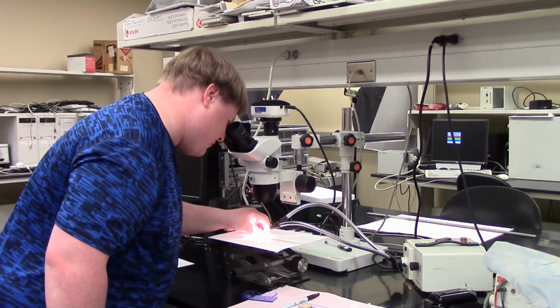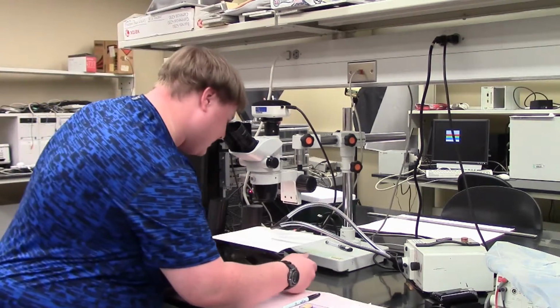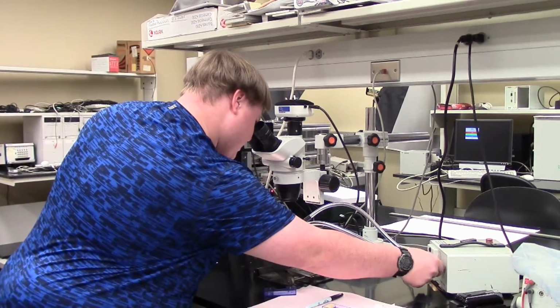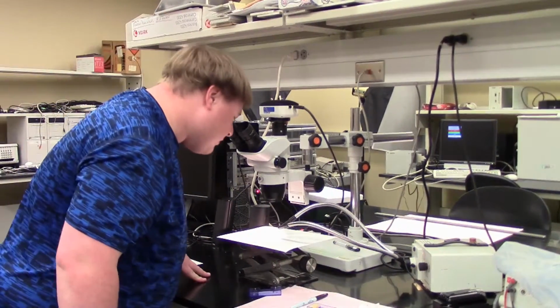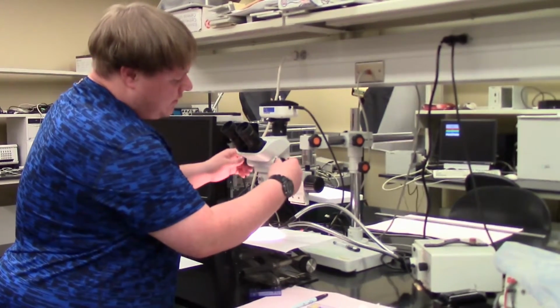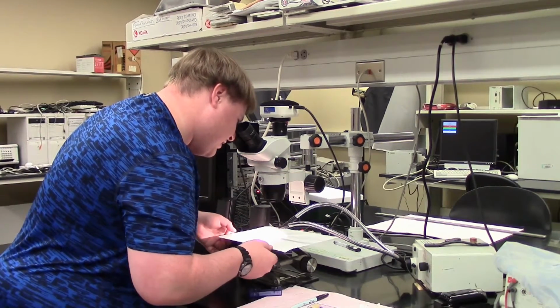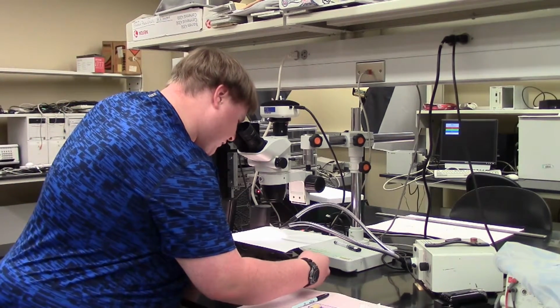You put it right where you need to be, and then once you focus, in this case it's actually pretty well focused. Also, if you need to adjust the light, adjust the light. And in this case, we can add a bit more light because of the contrast. So now you go back to zoom in again. Double and triple check to make sure that this time you do your adjustments on where it is to what you're measuring. Try to focus in on the T.